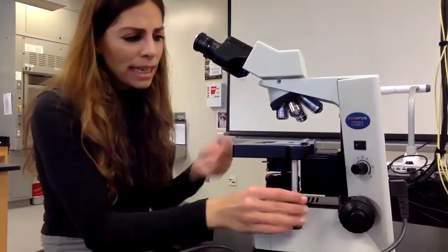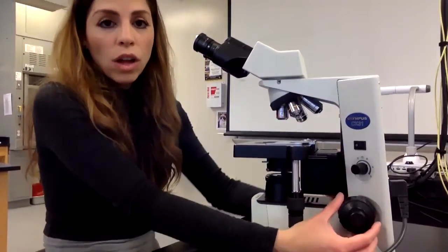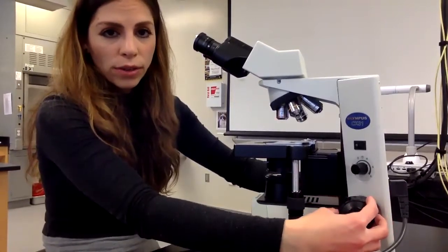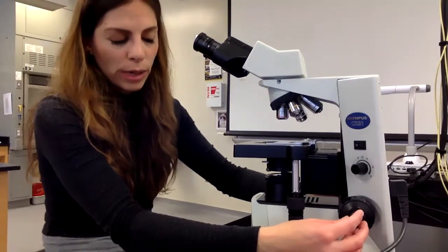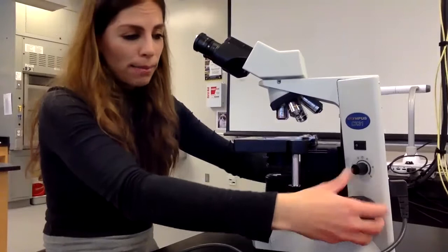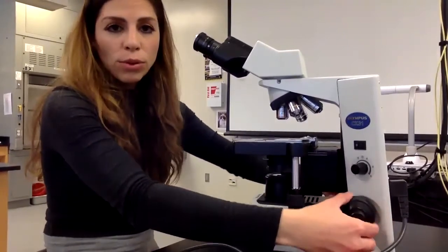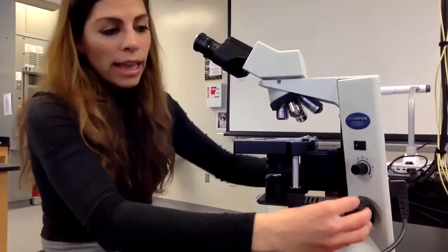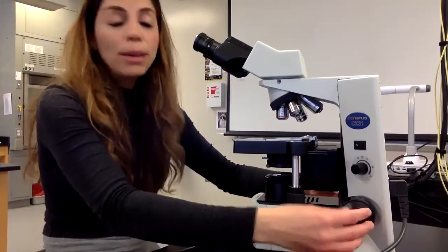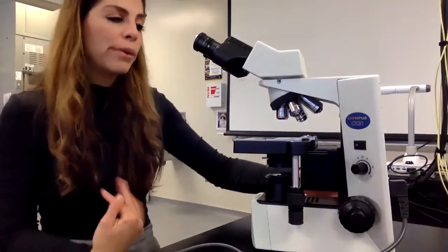So I'm going to center my slide, and then this knob right here is called the coarse focus knob. There's 2 knobs right here. There's this called the coarse focus knob, and there's a little one called the fine focus knob. The coarse focus knob, if you were playing around with it, gets your stage to go up and down. So here I'm going up and down, and I'm just moving the coarse focus knob. Now, the fine focus knob also gets your stage to move up and down, but you can't see it moving up and down. It's just very, very slight, and we're going to talk about how we use that.